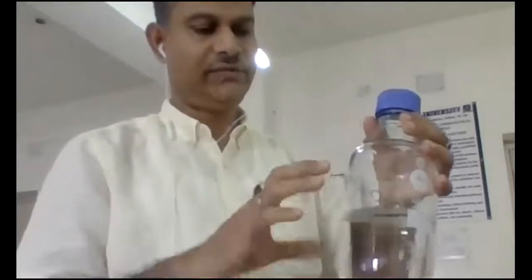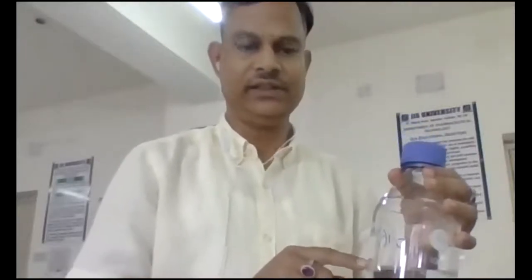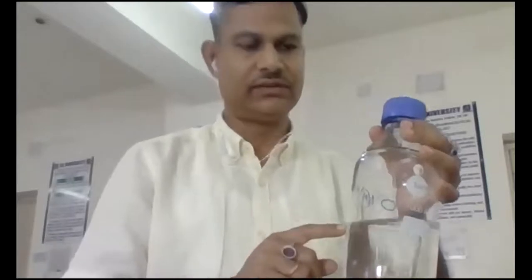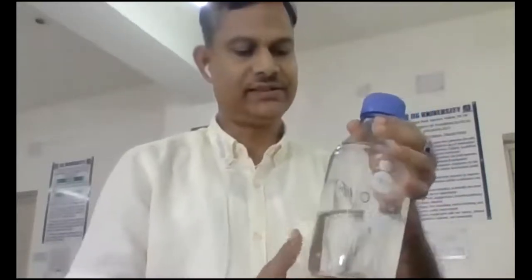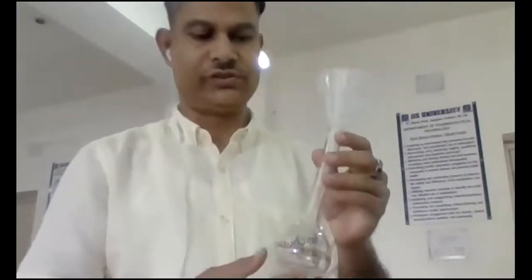First, here you can see this is the 500 ml 0.1 N NaOH solution. In this container, I have taken 500 ml of distilled water, and 2 gram of sodium hydroxide is dissolved in this 500 ml water, and it is labeled as 0.1 N NaOH solution. Next is for preparing the stock solution. This is the 100 ml volumetric flask. Here we will add the drug and we will make up the volume up to 100 ml.